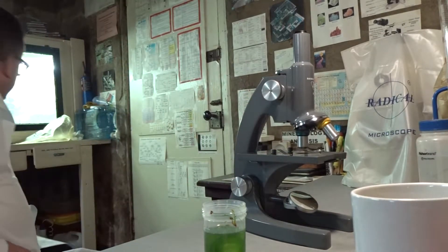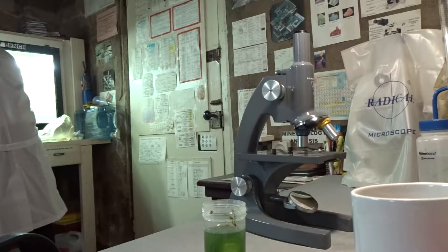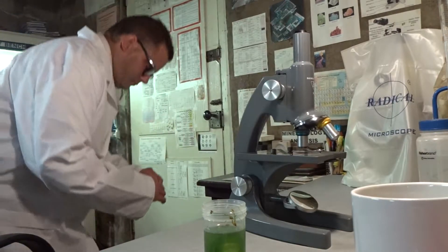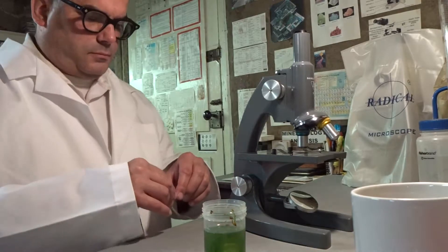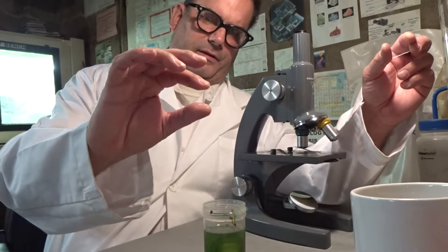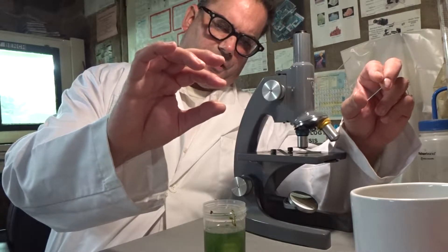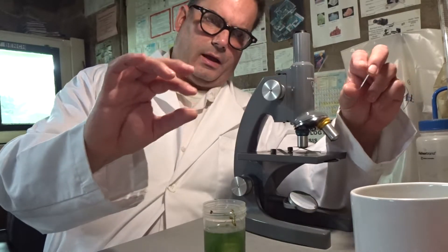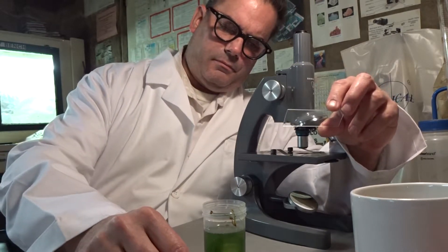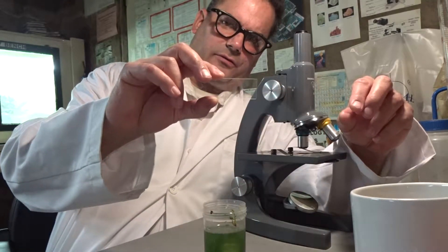I need you to get some equipment. I have a cover slip made of glass — it's a square piece of glass that's very thin, very fragile — and a thicker microscope slide. It's also made out of glass and transparent.